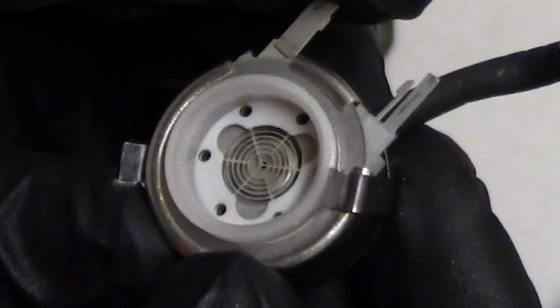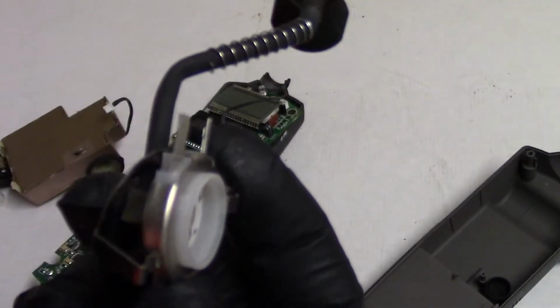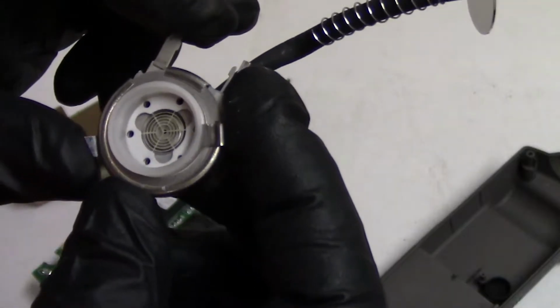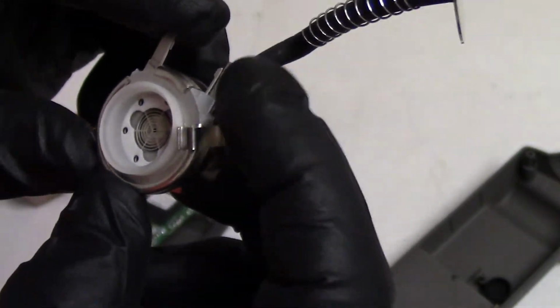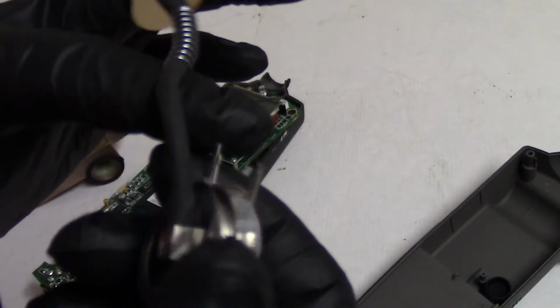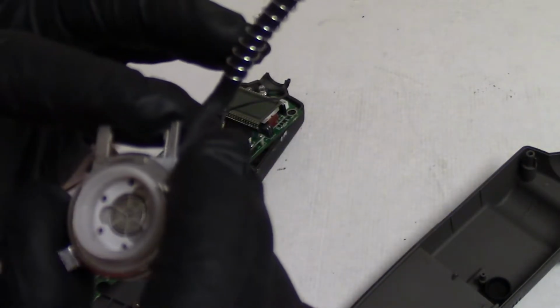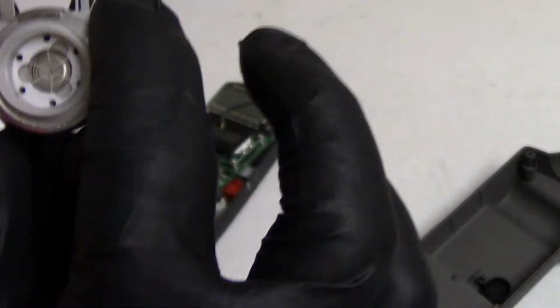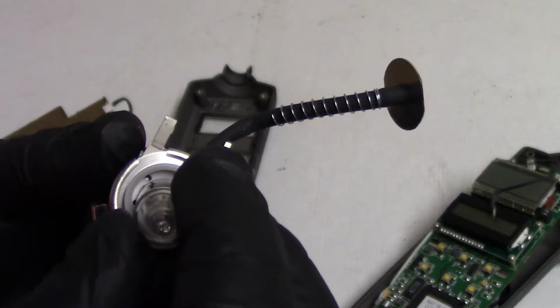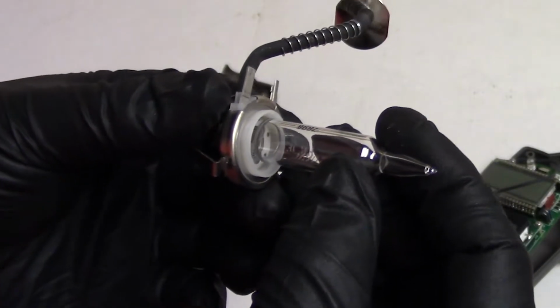And looking at the way this is made, the negative high voltage, oh, we can see it. You can see how it's layered. Negative high voltage is the closer one, probably the grid that we're looking at. And then the ground, which I think was this side, is going to be the other plate. And then the tube sits right here, like that.